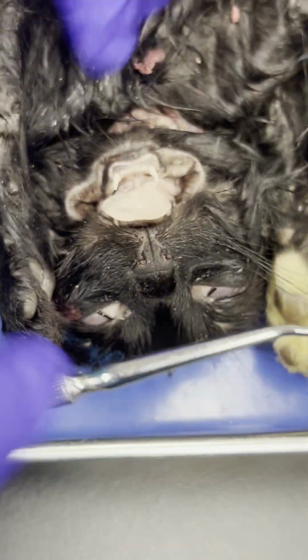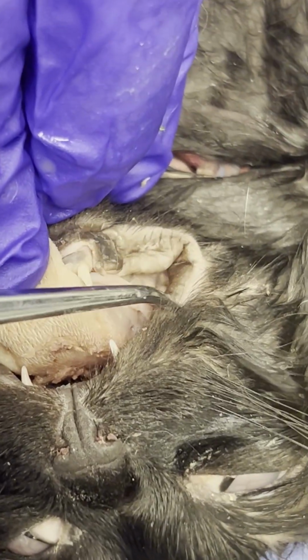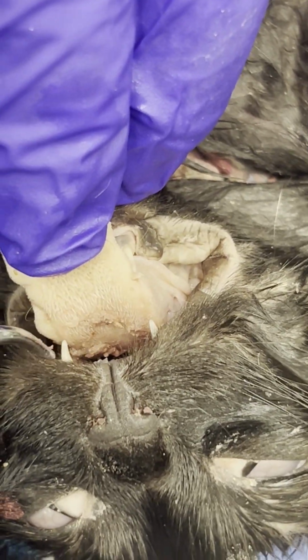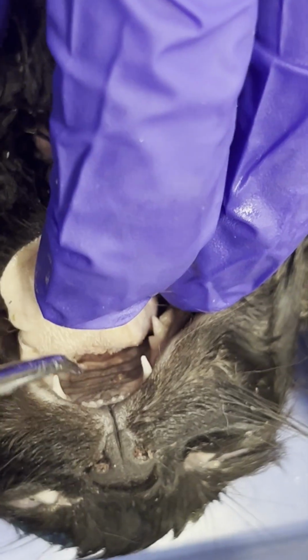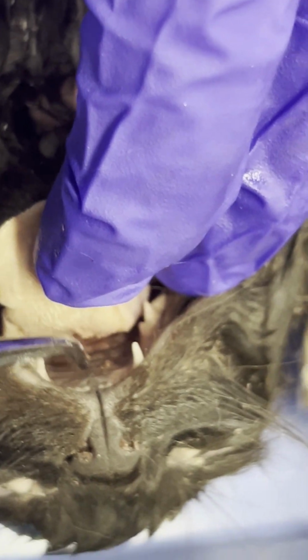All right, other structures. We have the labia of the cat. So labia, of course, means lips. So here's the labia of the cat, where my probe is, not where my hand is holding. So here's the labia. Here's some labia right here too. So again, the lips. We also have the hard palate of the cat. So hard palate is basically the roof of the mouth.